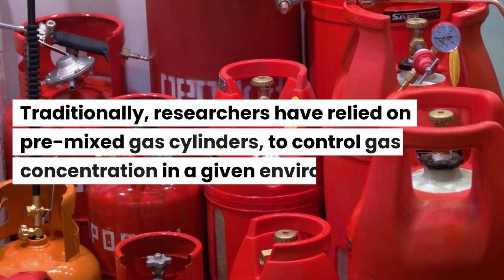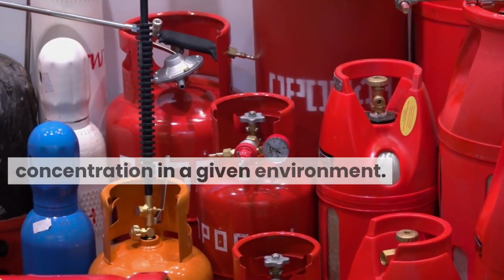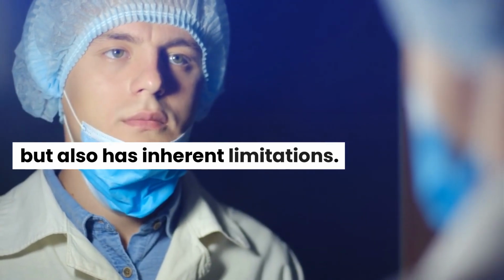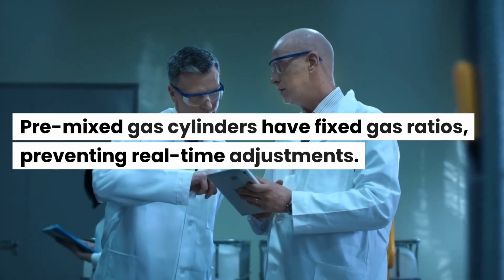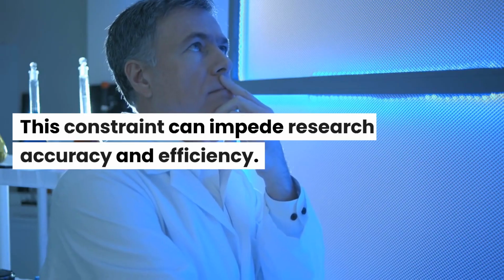Traditionally, researchers have relied on pre-mixed gas cylinders to control gas concentration in a given environment. However, this approach is not only expensive but also has inherent limitations. Premixed gas cylinders have fixed gas ratios, preventing real-time adjustments. This constraint can impede research accuracy and efficiency.